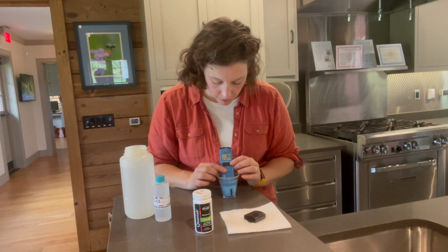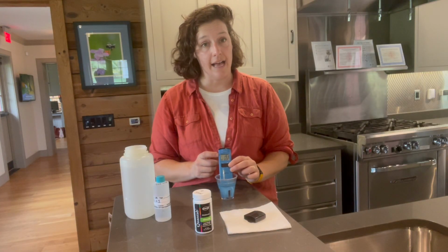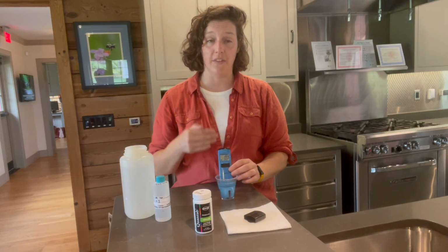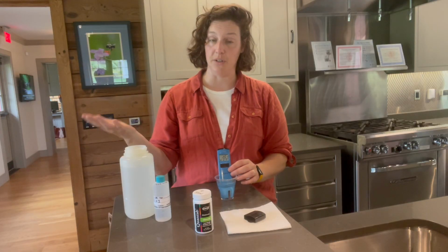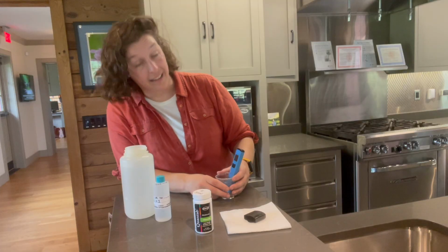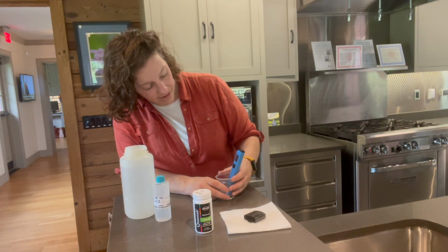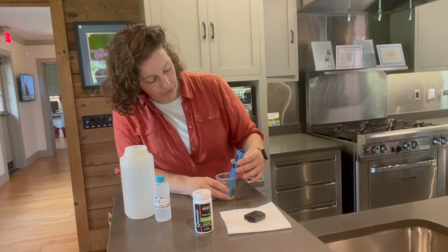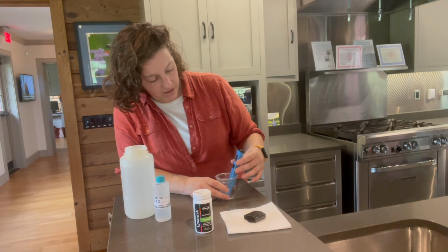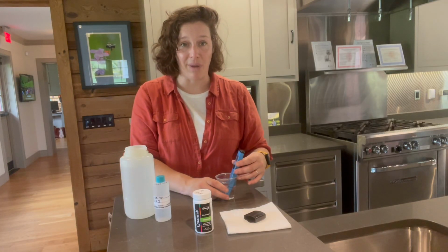So what is important is if you keep an eye in the upper corner, there is a small hourglass that's blinking. We want to make sure that that blinking hourglass disappears to get the reading. It can take a couple of seconds, so don't be anxious. All right, and it looks like our conductivity reading is 194 microsiemens per centimeter.